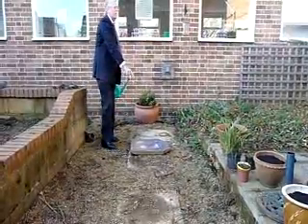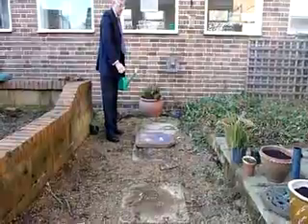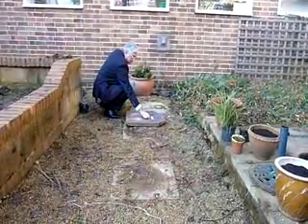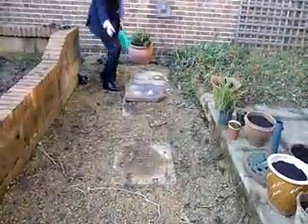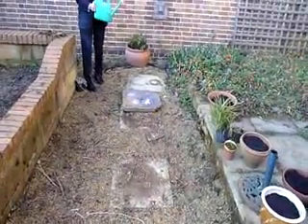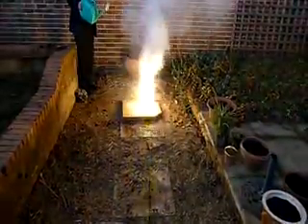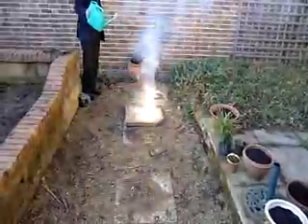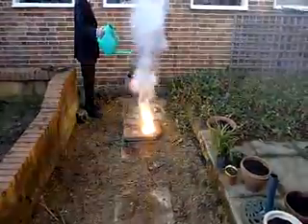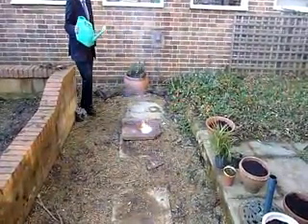The magnesium powder is now burning, and there it is, it's burning away. Have you got some sand? No, I haven't got any sand, so I go, oh no, put the fire out. I've got water, what happens if I put water on it? Nice! You cannot put a magnesium fire out with water.